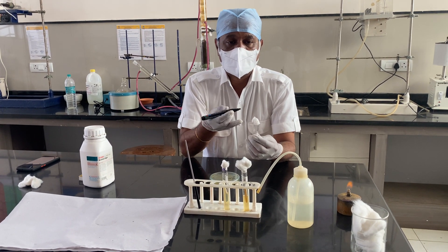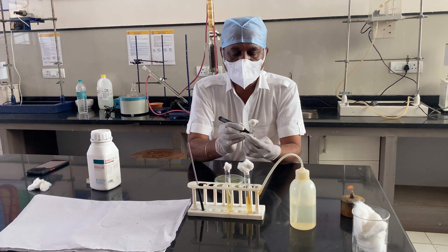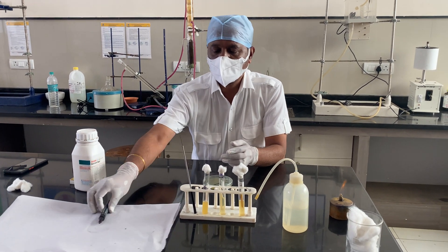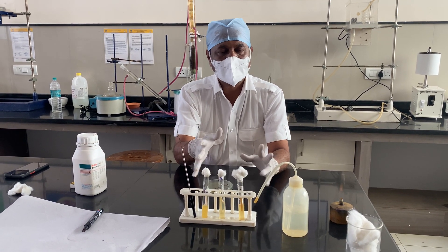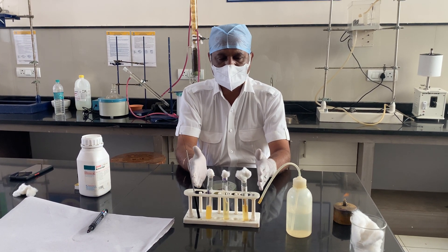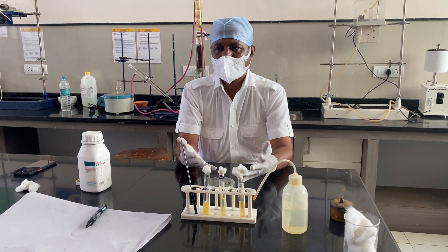I am doing this transfer to check whether any growth occurs. I will maintain the temperature at 37 degrees centigrade for 24 hours. After that, we will come to a conclusion about whether the transfer was done properly and whether growth is present. This is also the reason why it is necessary to understand the limited survival period of stored microorganisms.